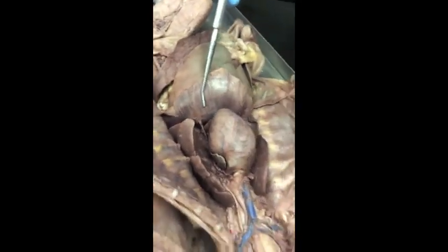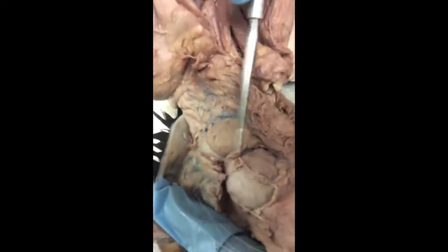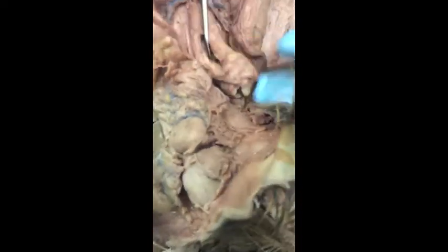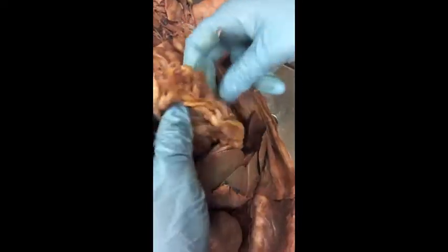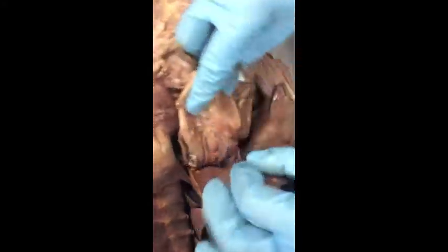All right, so in the digestive system, right, we've given up on the parotid gland. This big, large gland here on the underside of its neck is going to be the submandibular salivary gland. We already covered the esophagus running behind the trachea. It's going to run all the way down through the diaphragm to the stomach. So this is the stomach here.